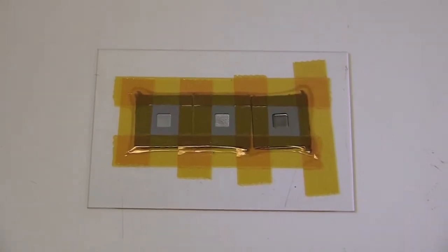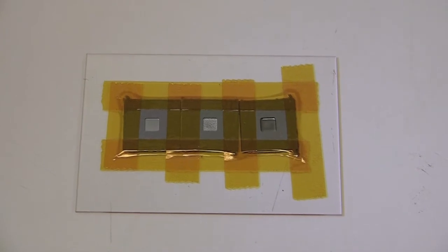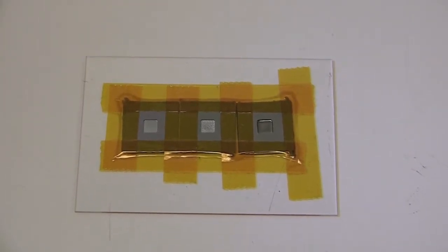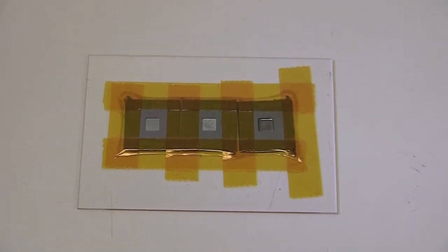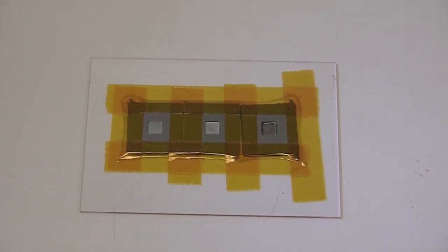This is a small segment on how to prepare your sample for using the xenon difluoride machine. As I mentioned earlier, the xenon difluoride is load dependent, so whenever you put a sample in there, you want to minimize the amount of exposed silicon and just focus on whatever you're trying to etch.